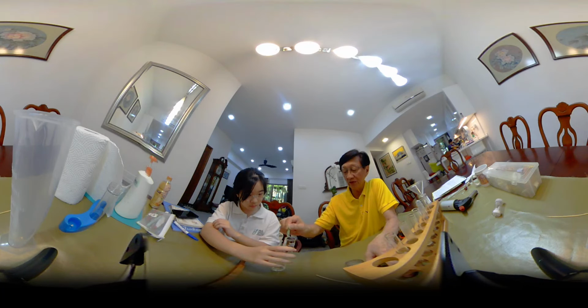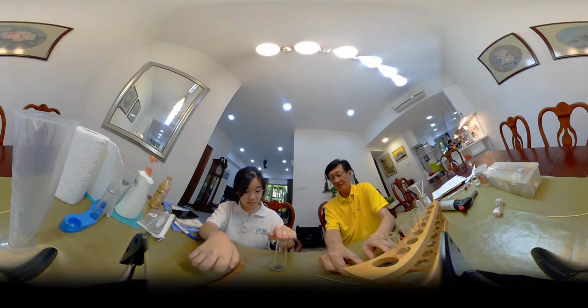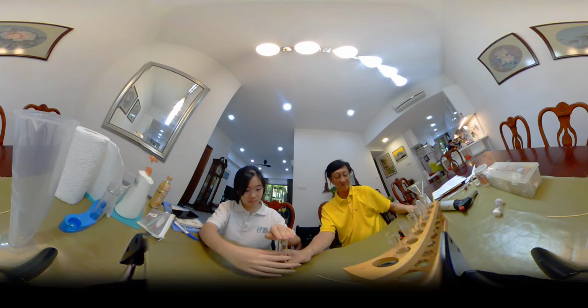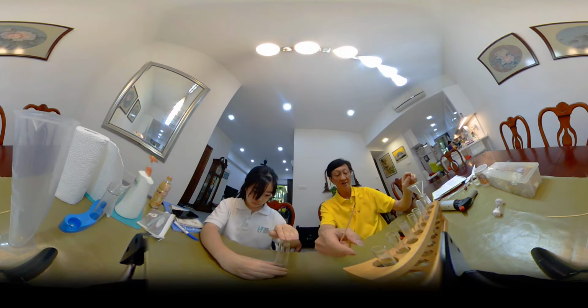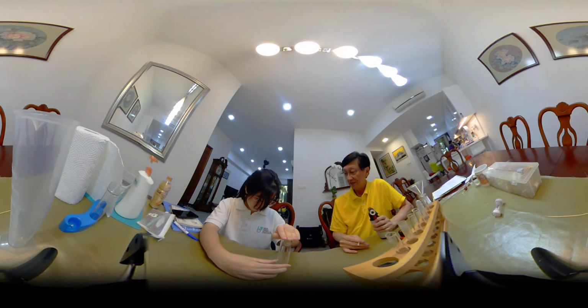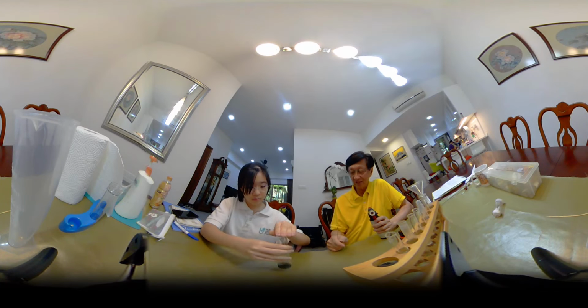Put your finger over it to cover. Hold the bottom here. Is the pressure building up? A bit. Okay.